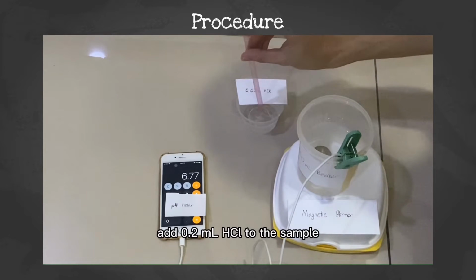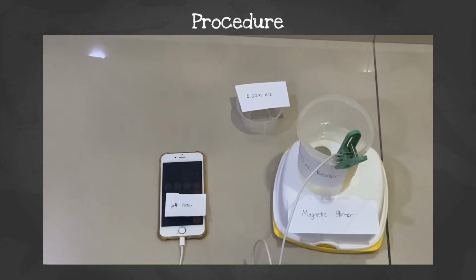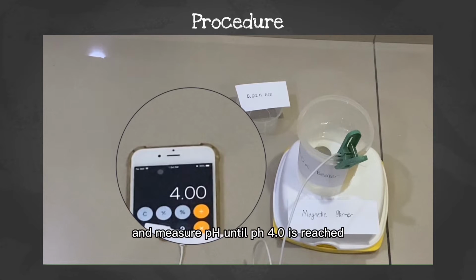Add 0.2 ml HCl to the sample. After each addition, mix the solution thoroughly but gently with the magnetic stirrer. Record the pH when a constant reading is observed. Continue adding titrant and measuring pH until pH 4.0 is reached.